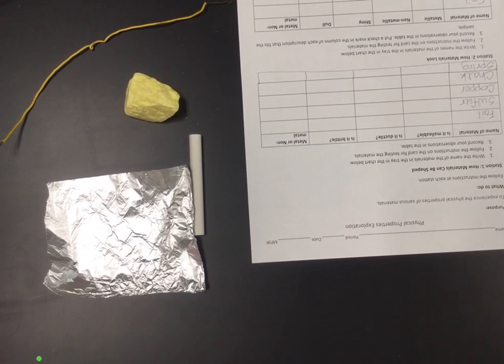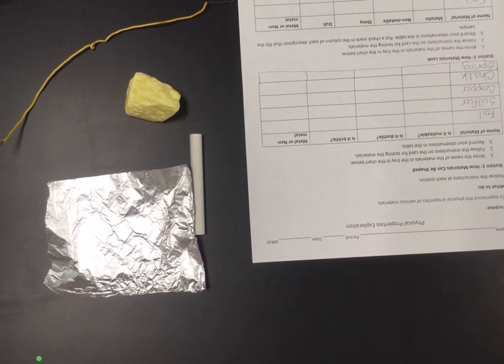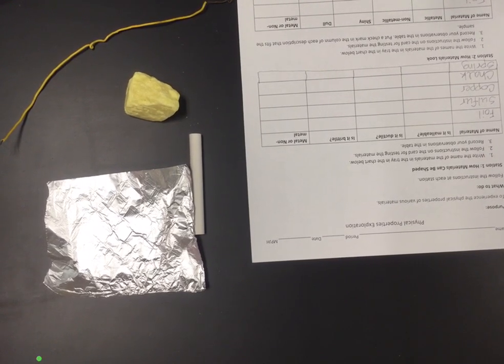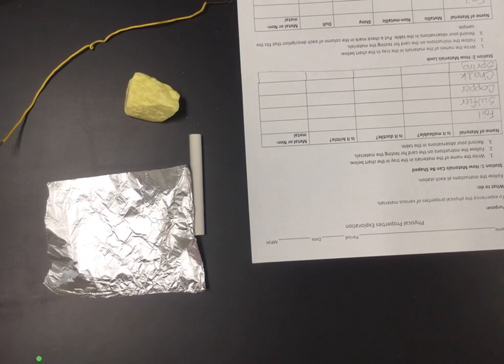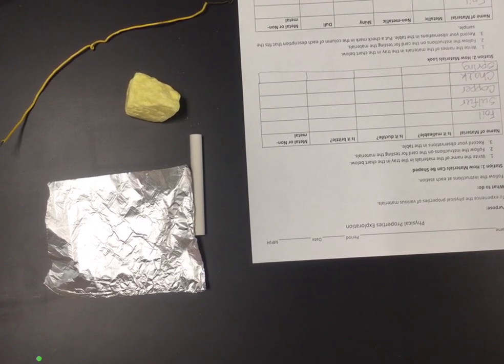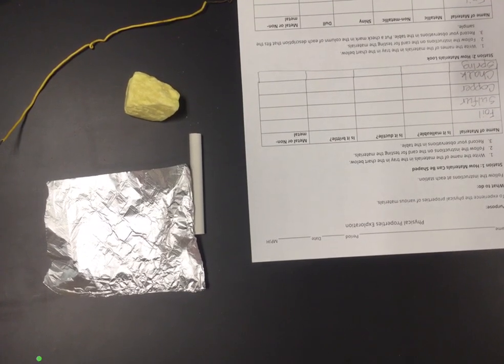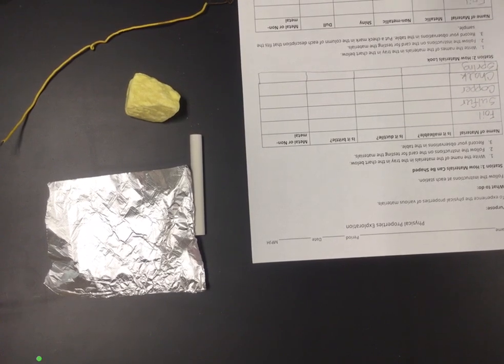We are going to demonstrate this lab for you and show you the data that we are going to observe, and you are going to fill out your sheet along with us. You may have to pause to take a few minutes. For this first part, take a few minutes and fill in all of the different stations with the same items that are going to be tested, because every single station tests the same items.